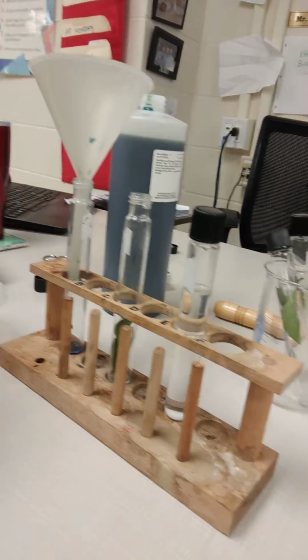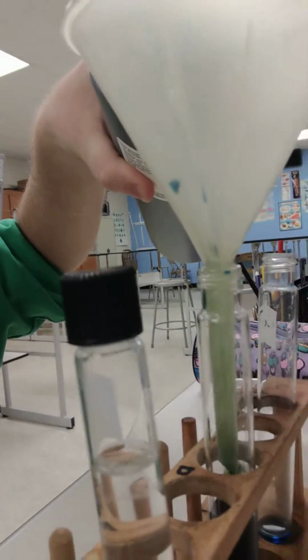So what we've got here is some test tubes set up, and in the test tubes I put a couple of our leaves, the same leaves that we used today to measure photosynthesis, so you know it's going to have some stuff going on there. Now, as we talked about today, the plants are producing oxygen. So we're going to test what happens when we put these things in light, which means that it should produce oxygen, and when we put them in darkness.